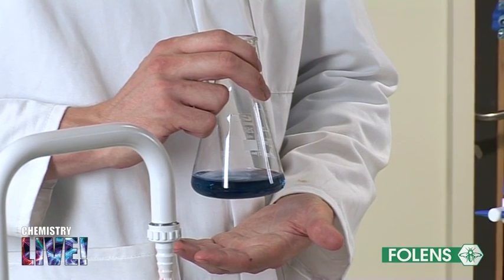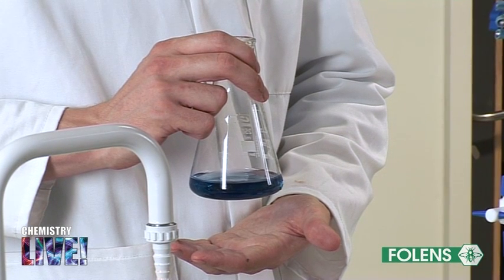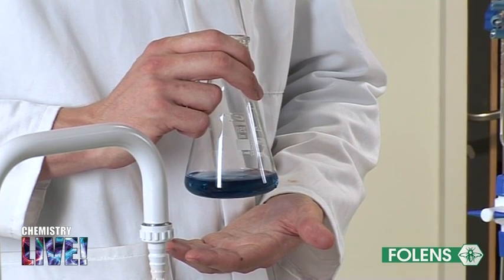The endpoint can be quite difficult to detect as the color change is not as obvious as in the case of acid-base indicators.